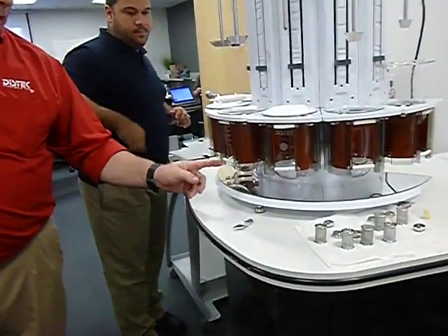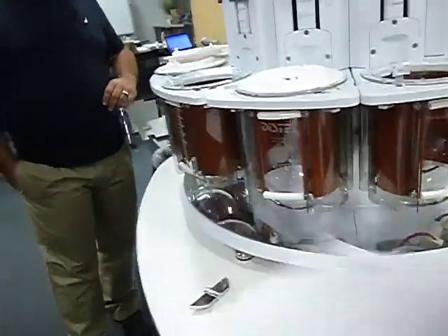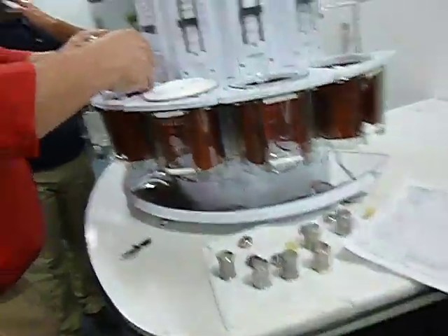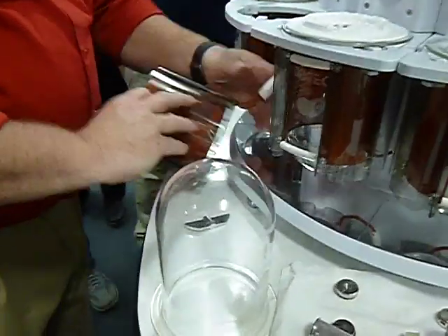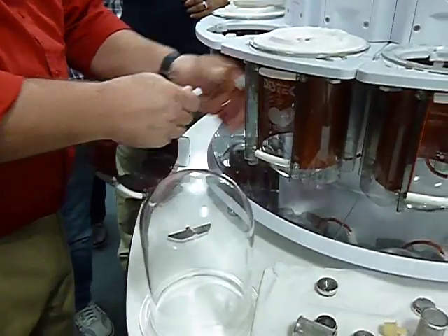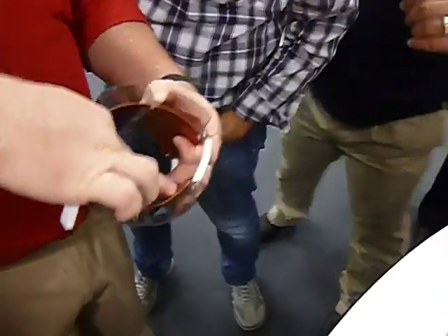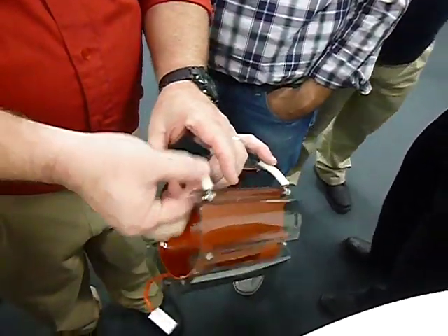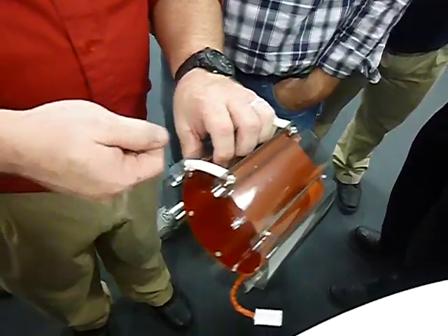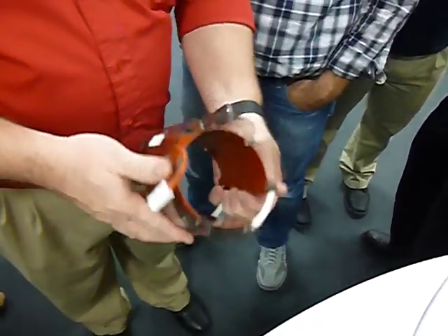These have a tendency to break on one side or the other, in which case that spring would need to be replaced. It's a bit of a pain to change it. Since we're here in training, I might as well pull it off and show you. If you have to change the spring out right here, there's a Phillips screwdriver on this side. That's the screw. Nut on this side, and it pulls the spring off, and of course it's covered in this sleeve right here. So you have to make sure the new spring, take the old cover off, put it on there, attach it on both sides to make sure that it works.